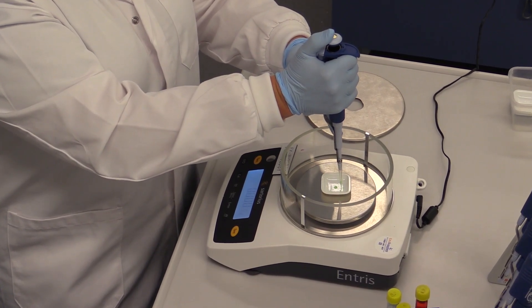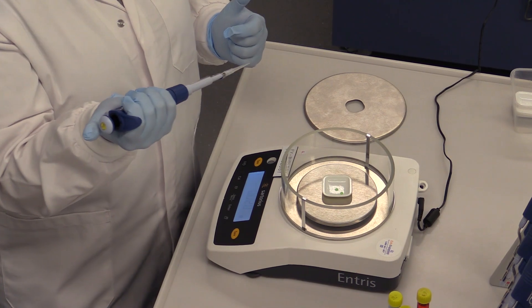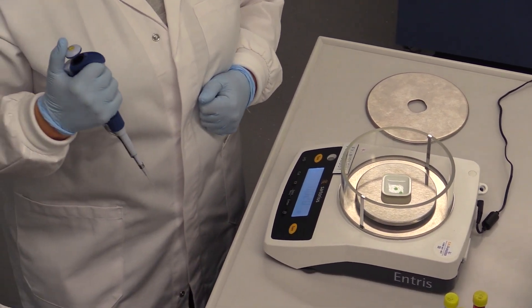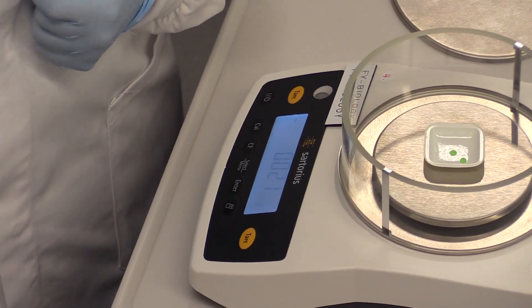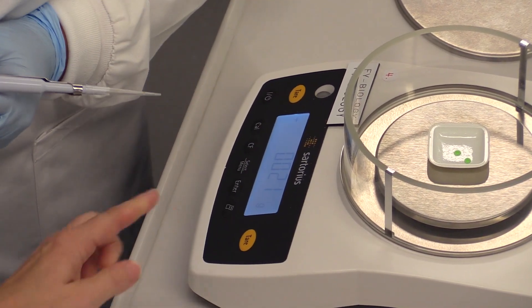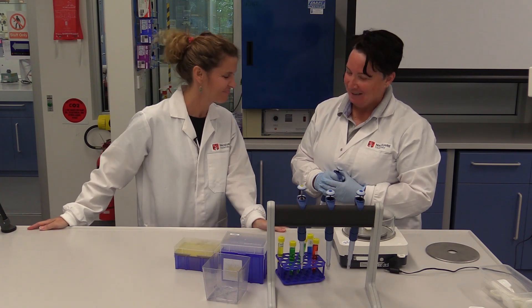Try again. I've still got a drop. What am I set on? I've got 22. It's just not working — it's 21. It's pretty good. It's 21. I think you did well. It's okay. Thank you. Well done. Thank you.